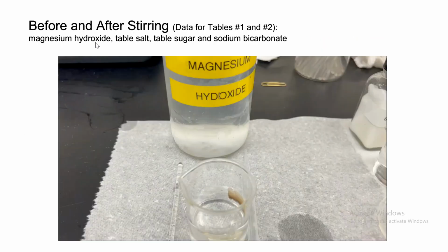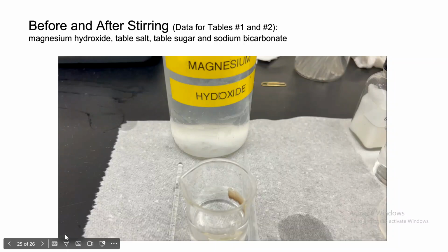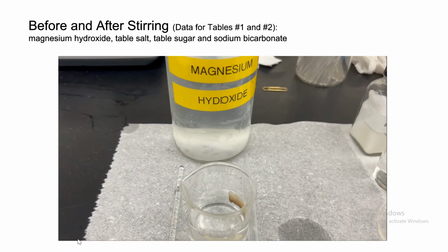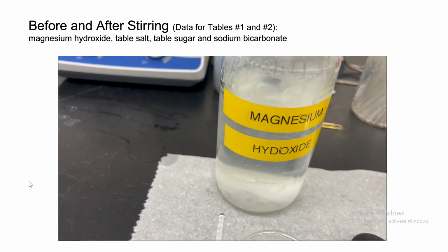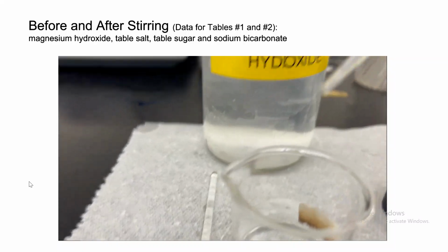Now let's go back to before and after stirring. Now this is for tables 1 and 2. We are going to talk about magnesium hydroxide, table salt, table sugar, and sodium bicarbonate. So now let's test it. We're going to take magnesium hydroxide and put it in water.